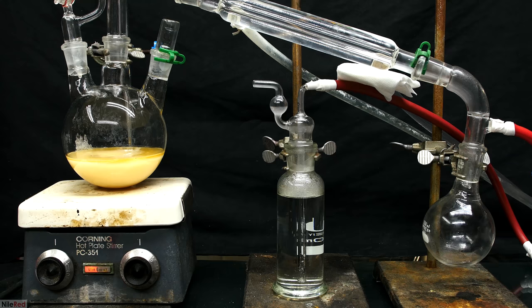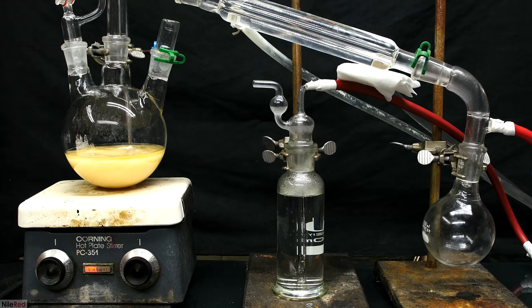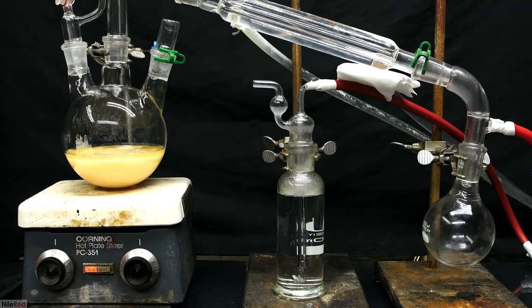One thing that totally didn't occur to me when I did this, was that the volume of the hydrochloric acid solution would increase. I ended up being really lucky, and it didn't overflow, but it could have ended up being a big problem.